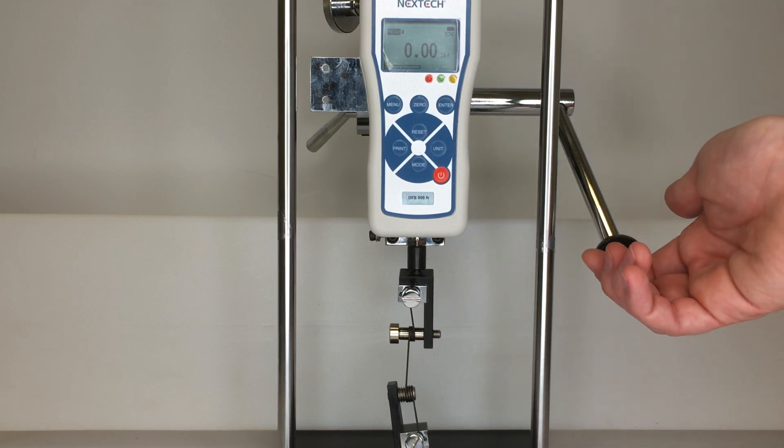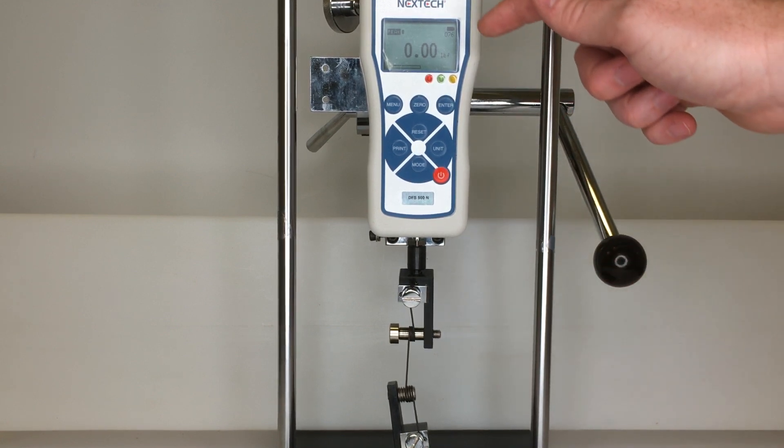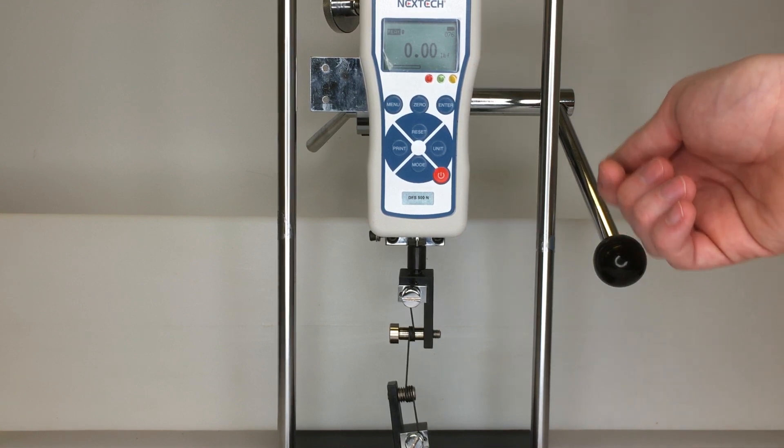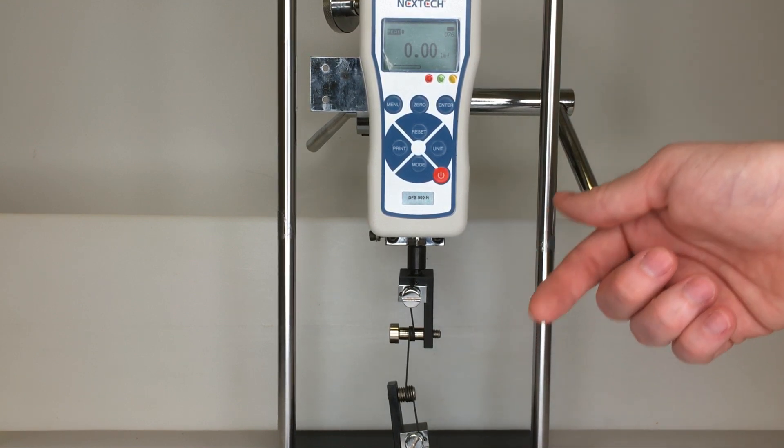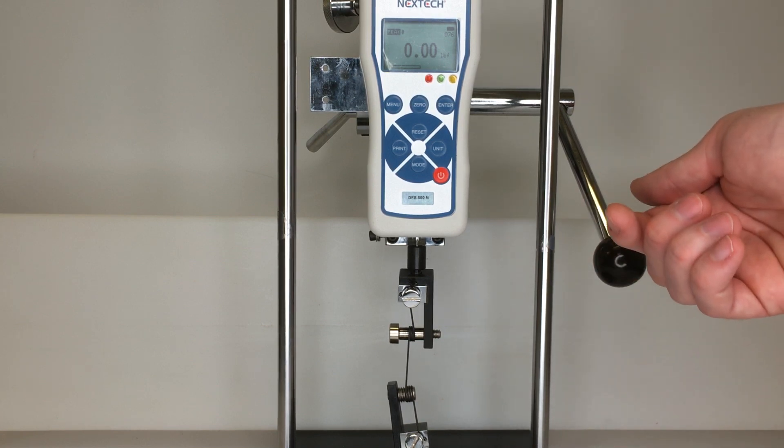We are going to pull up on this lever and as I do that you are going to see this force increase and eventually the carbon nanotube yarn will break and we will have the maximum force that this yarn can sustain.